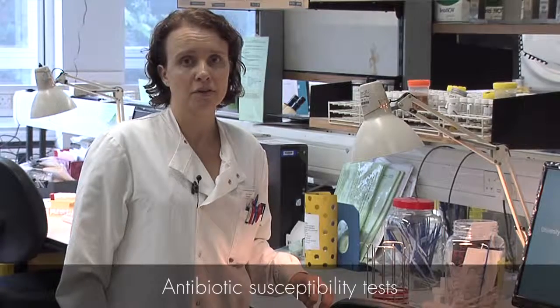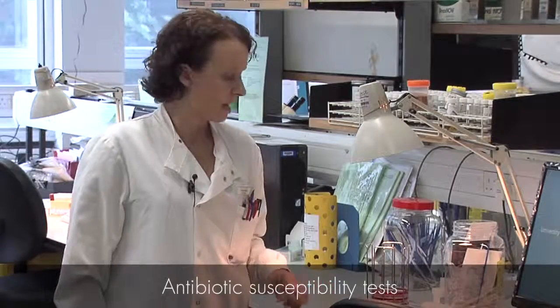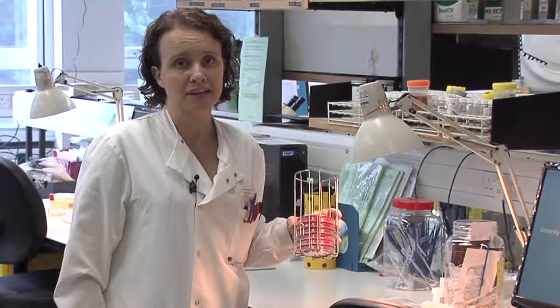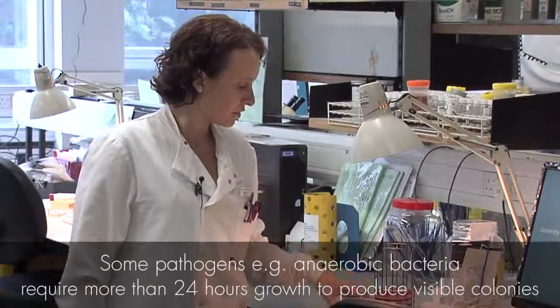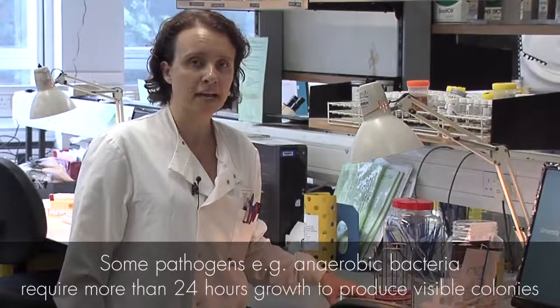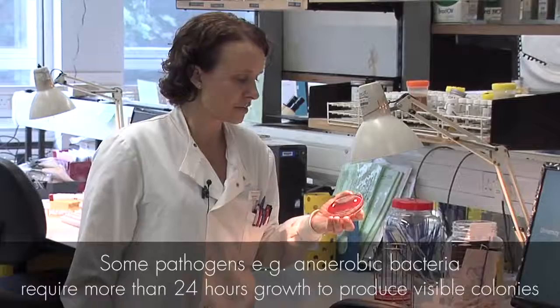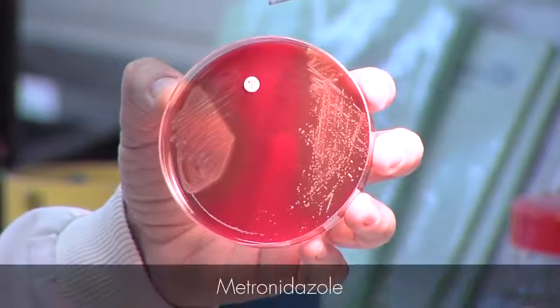We would also do antibiotic susceptibility tests on the organisms that are significant. And some plates we would have to re-incubate for additional incubation, and some plates do not come out until after 48 hours incubation, such as anaerobic bacteria, and this plate shows an anaerobe which is sensitive to metronidazole.